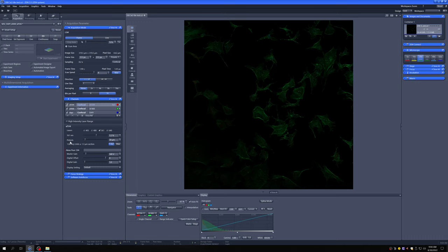So you can see here there's a thing that says pinhole. There's a slider. I can move the slider. And as I move the slider, this number changes, this number changes, and this number changes. This is the diameter of the pinhole in microns, which by itself is hard to interpret. It doesn't really mean anything to us without more knowledge of the optics in the system. This is the diameter normalized to something called airy units, which are comparable across confocals. So it's a very useful way in which to measure the pinhole. And they also depend on wavelength. So they're normalized to wavelength.